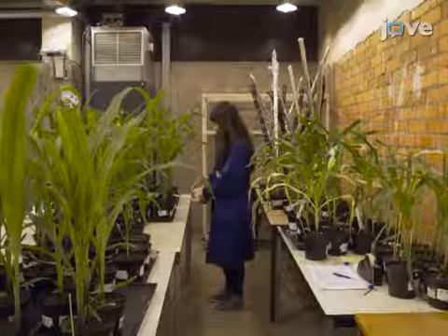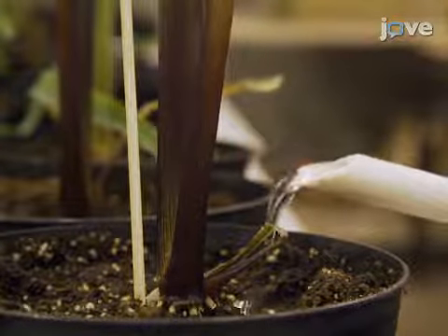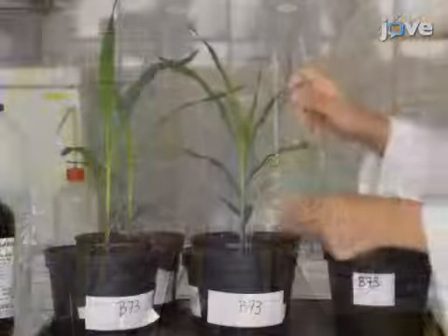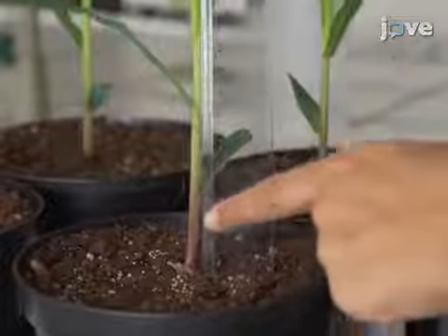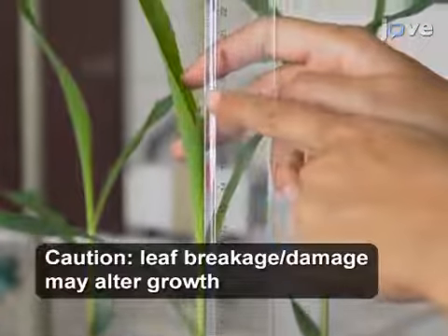To perform a full kinematic analysis of leaf growth in monocots, grow at least 15 plants for each treatment and genotype under controlled conditions in a growth room. When a leaf of interest appears, use a ruler to measure the length of the leaf, that is, the length from the soil to the tip of the leaf, daily until the leaf is fully expanded.